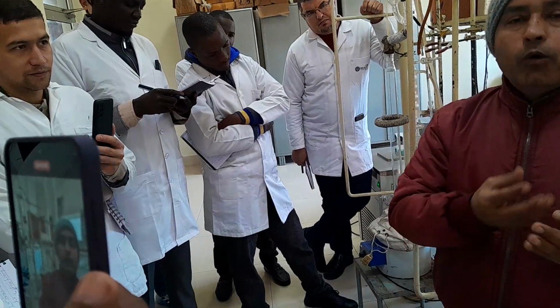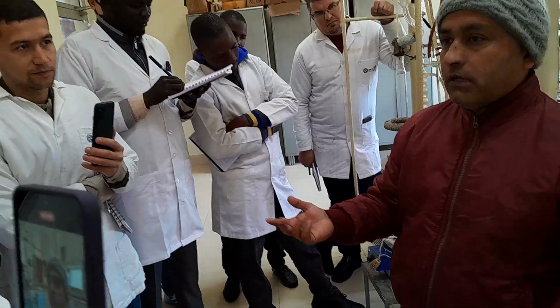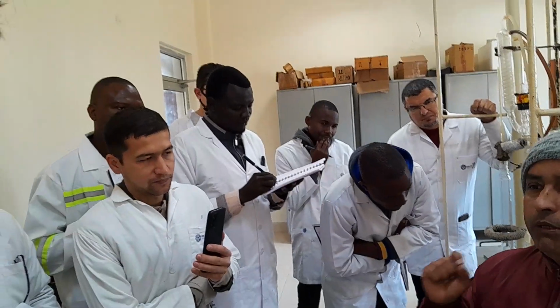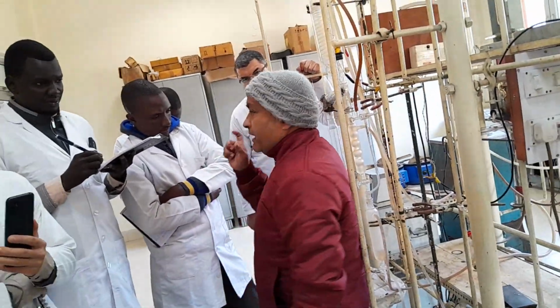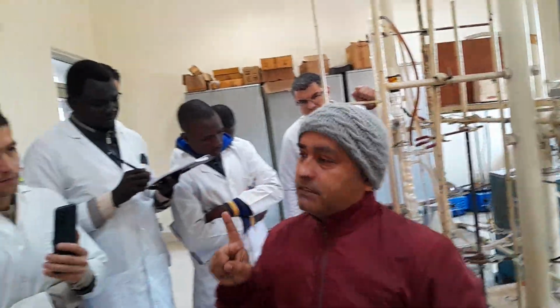After distillation, you check what is remaining, what is the product, and what is the loss. During the fractional distillation, your material balance loss should not be more than 1%.